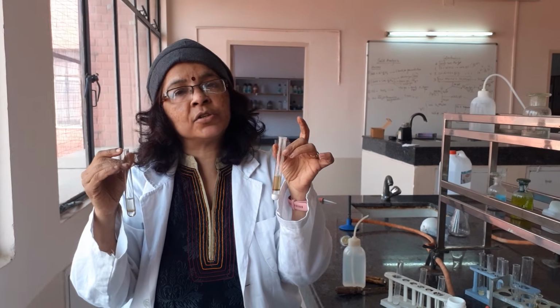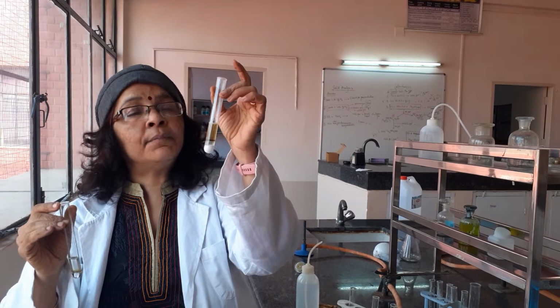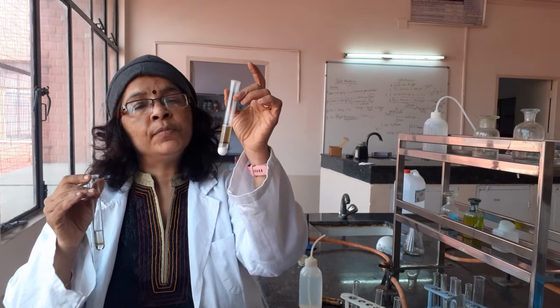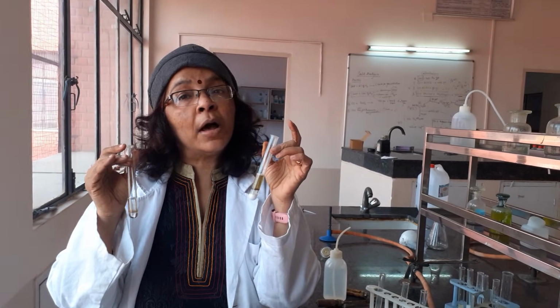So whether you do it after separating the liquid or you do it with the ppt, it does take some time, so have some patience. Whenever you have a cation of group number one or five, you will get a white ppt and your target is to get a brown ring inside that solution, whether you do it by transferring the solution or in the same tube, but it will take a lot of time. You will have to wait for the ppt to settle down. Fine, so with this we understand that the brown ring of nitrate is a tough task if you have the cations of group one and group five.